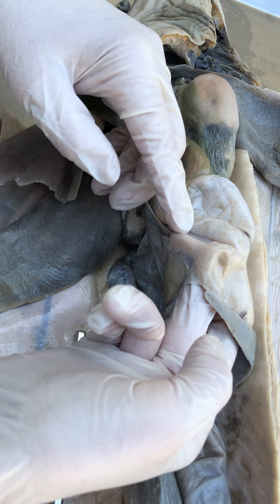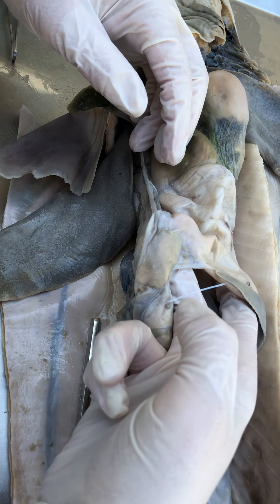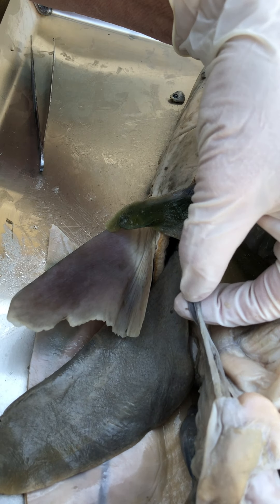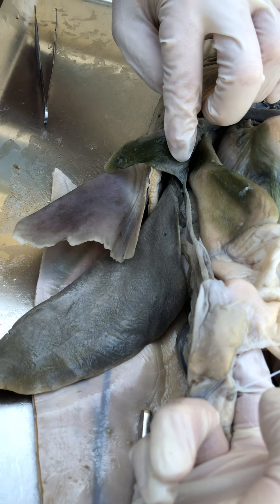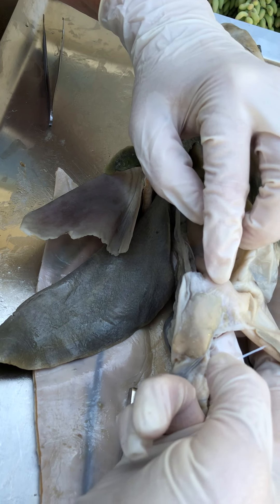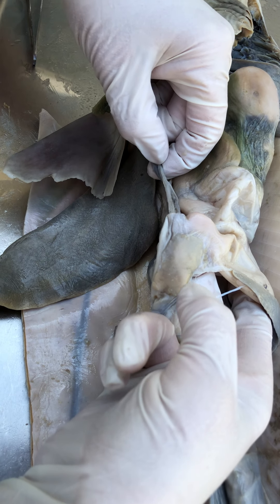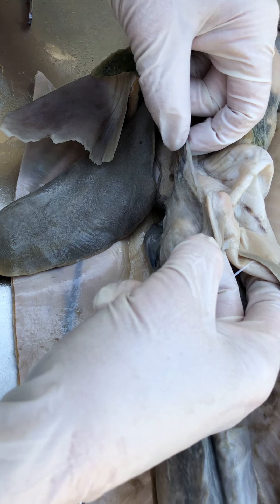This is going to be the beginning of the small intestine. Lifting it up, we can see these canals — we're going to have bile coming down a bile duct into the duodenum, into the small intestine. We'll also see a vein we'll discuss when we get to the circulatory system.